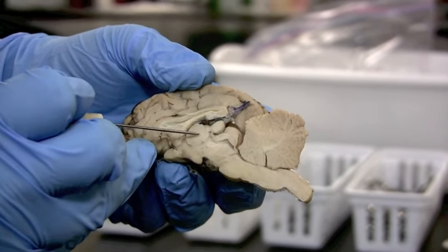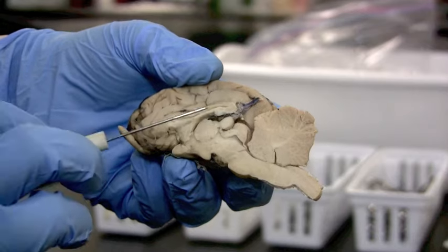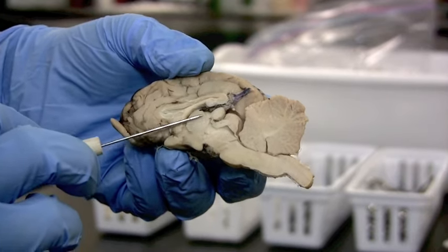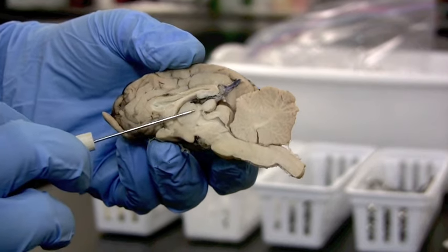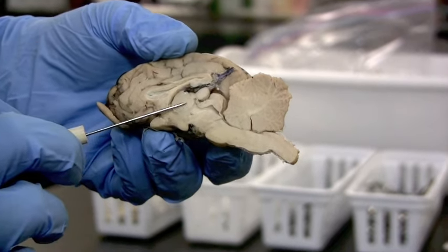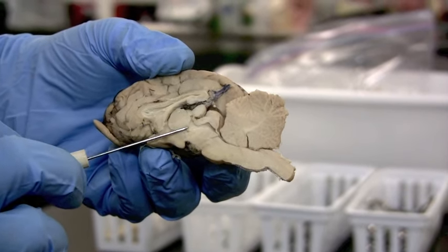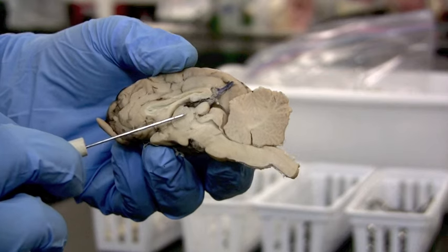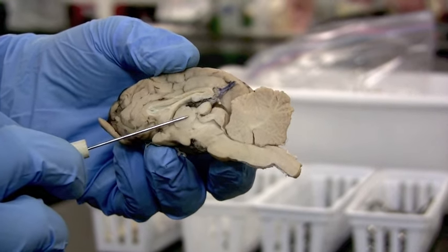Remember there are two sides, a left and a right side, so if we cut straight down the center, this is where the two thalami meet. The interthalamic adhesion is that part we talked about that's missing in 30% of males — the connection between the two sides of the thalamus.